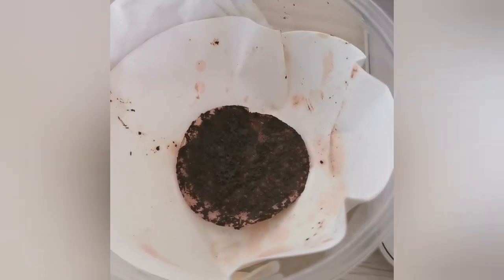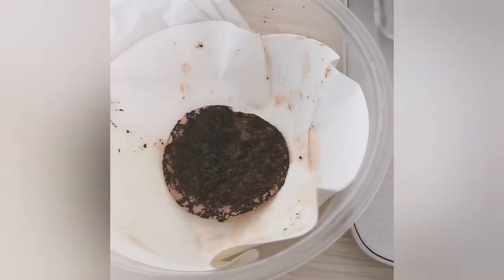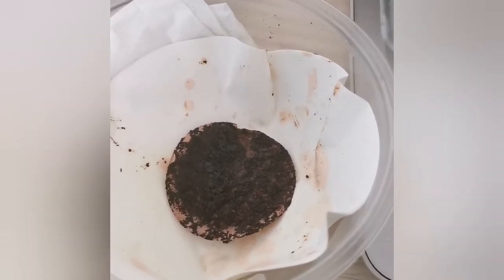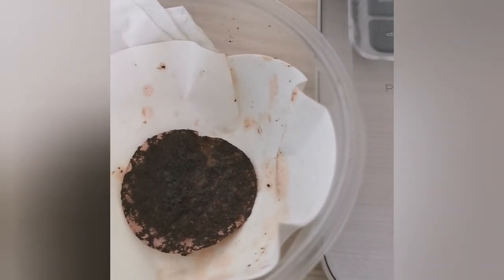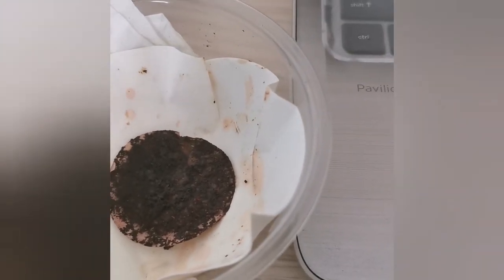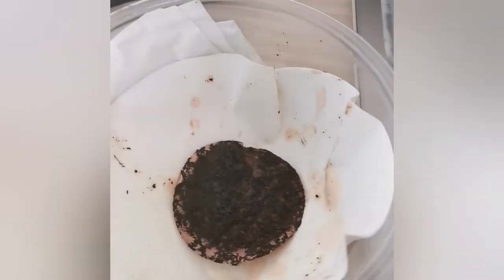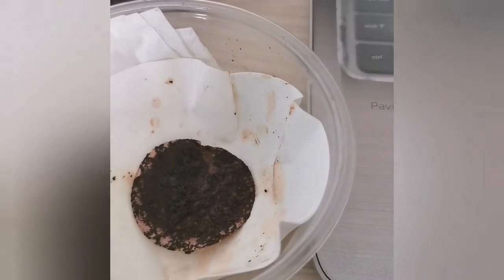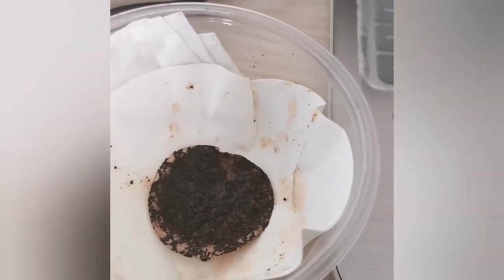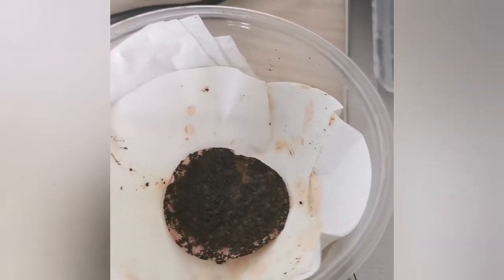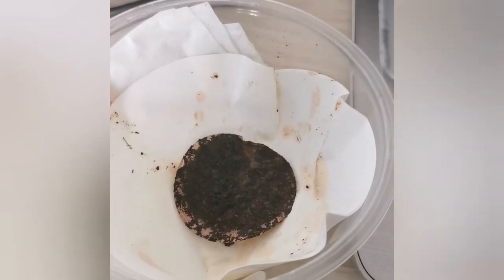So this is my result which is very dark brownish black. Everyone's color in the class is different, it varies through a whole spectrum from red to brown and even black and everyone's yields are different as well. Here are some pictures of my friends' results and I hope you enjoy the next few seconds.